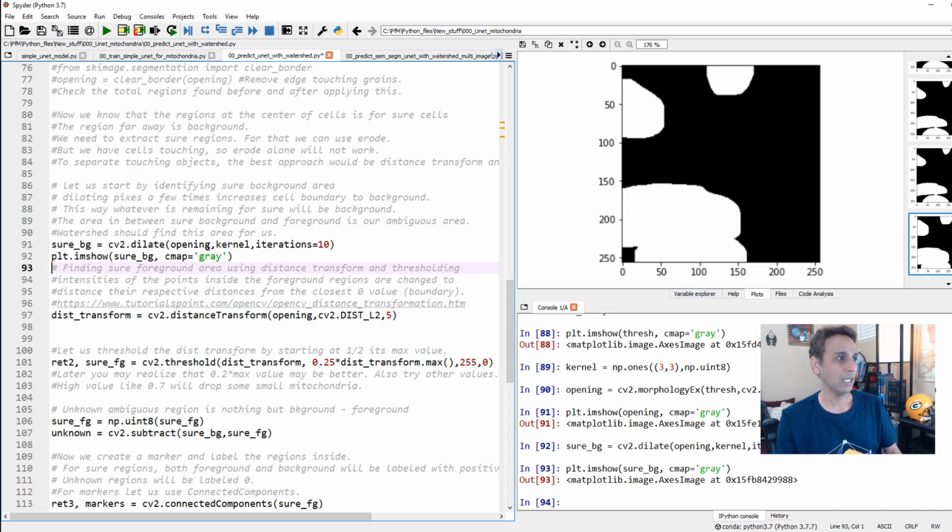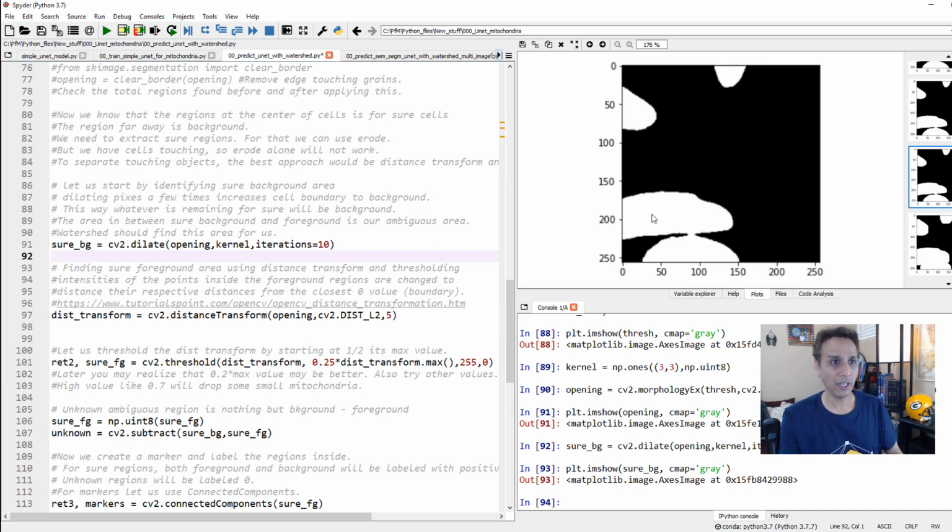showing that everything else I'm almost 100% confident is my sure background. And my sure foreground will be very similar, but how do you define your sure foreground, right? How do you define the center of mitochondria? If I go back to this image, how do you define this? If you only define the central few pixels, if your mitochondria is elongated, then how do you define this shape? For that, we have something called distance transform. It's actually looking at the distance and it maps that distance. Then we can set a threshold on the distance transform.